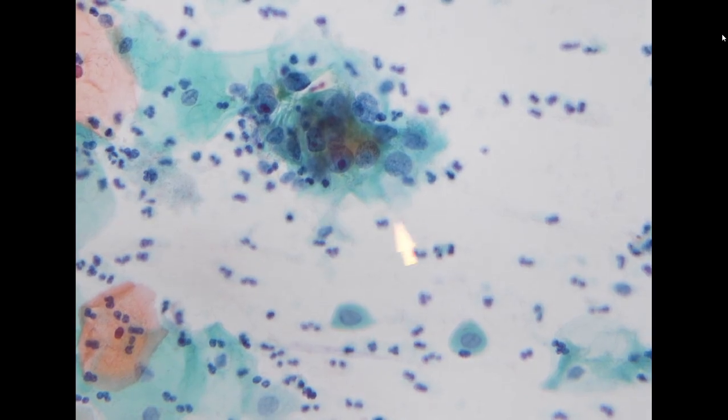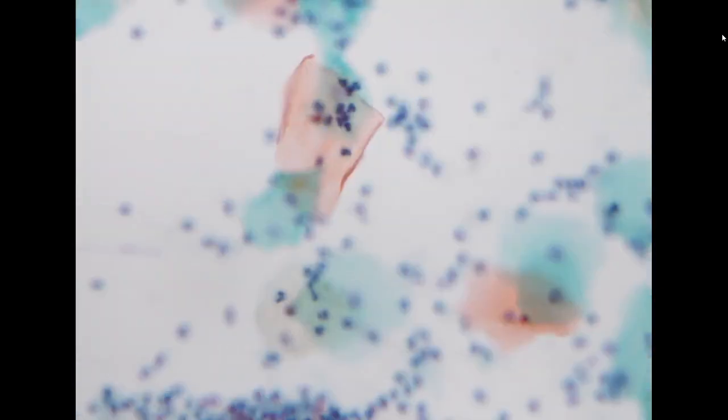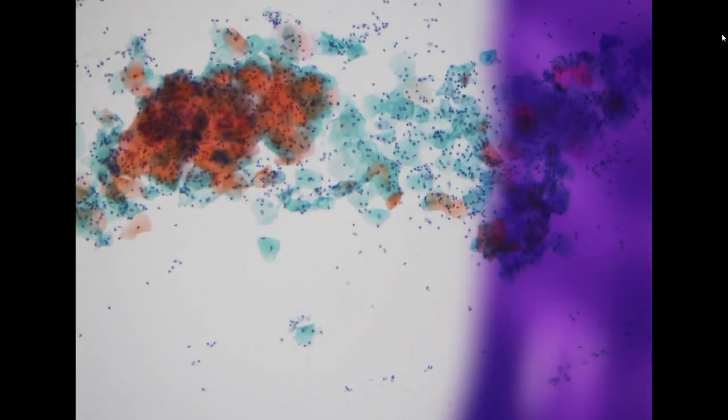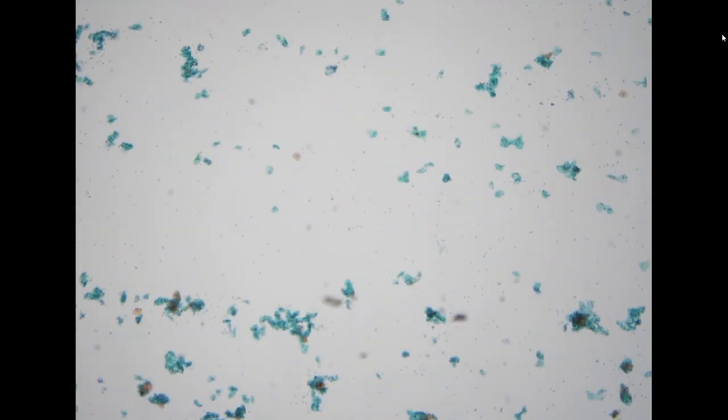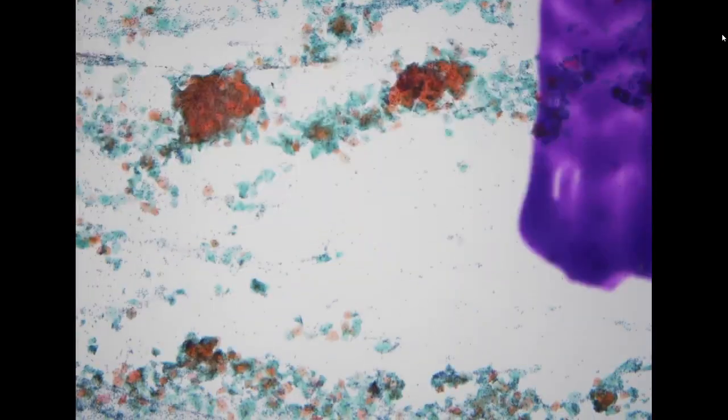So this is a good example of ASC-H. The screener originally called it CIN2. I think it's a little bit over because there is no definite feature of CIN. And the sign-out doctor would like to call it dysplasia, cannot exclude high-grade. But for me, looking at the cellular features, you didn't find definite low-grade lesion here, so it is also a little difficult to call it dysplasia, cannot exclude high-grade. So finally, I think ASC-H is a good diagnosis, and it also gives the patient the same follow-up strategy.